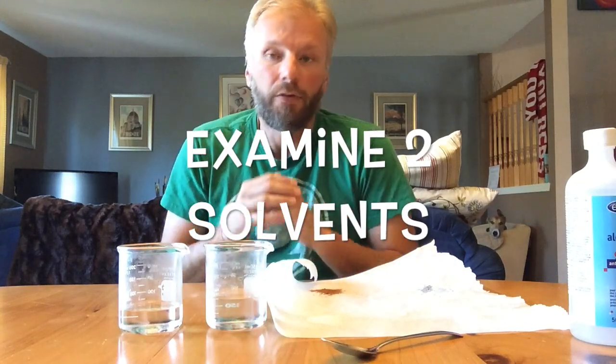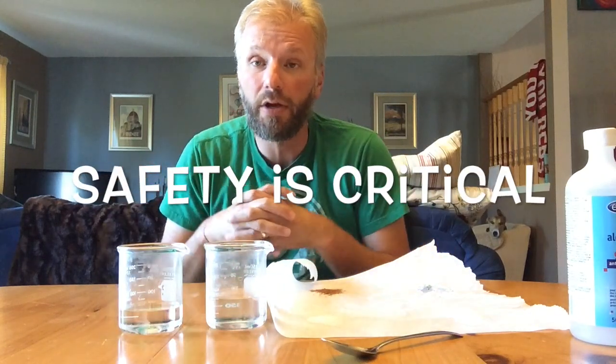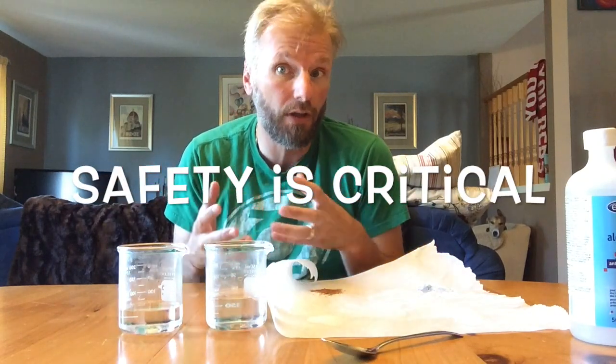So we're going to look at whether all solvents are alike. We're examining two solvents, and very important with this one: you never ingest anything, you never sniff anything, and you're very careful with this. So what we'll be doing is mixing things and seeing if all solvents are alike, because it's important to know if all solutes will dissolve in solvents. That allows us, when we're making or creating things, be it industrial, through food, or a number of other items, to know how items react.